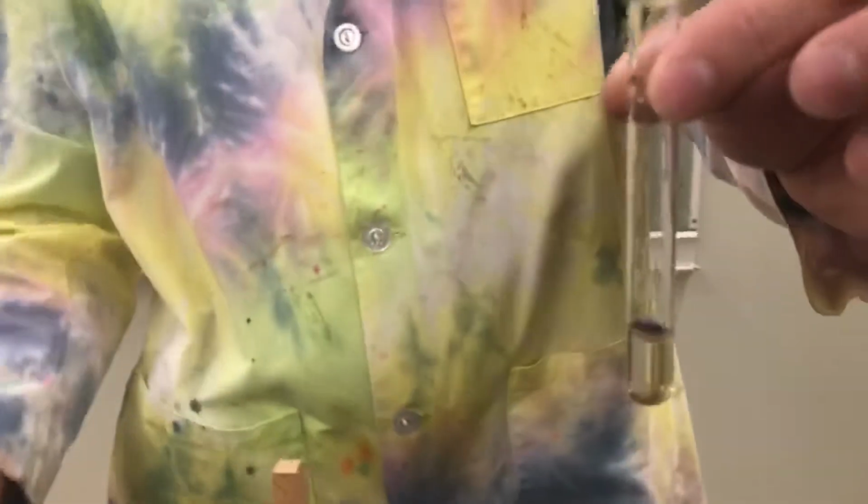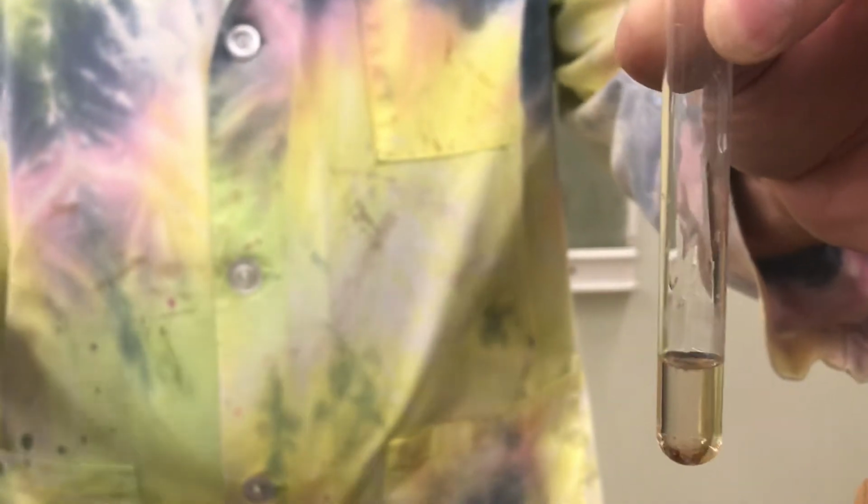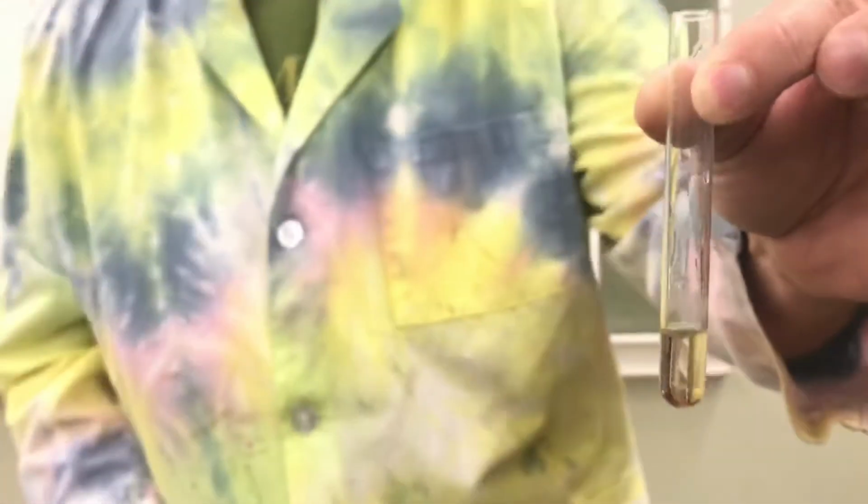Okay, now, you take a look at that, you can kind of see the color looks a little different, but it doesn't look much different than you would expect if you were to mix this dark-looking acid with a little bit of water. So we don't see a major color change. I try to smell it. I don't notice anything different than what I had before. You don't see solids forming. I don't see bubbles coming out.